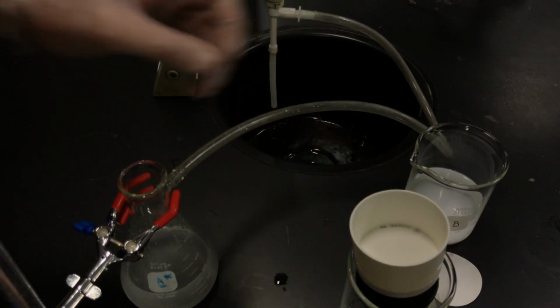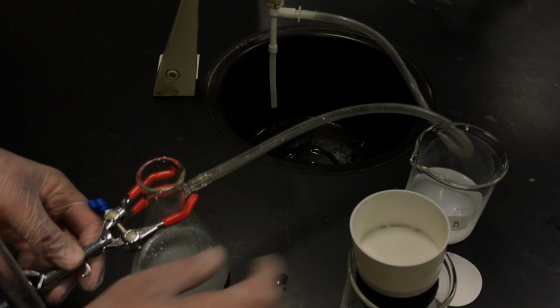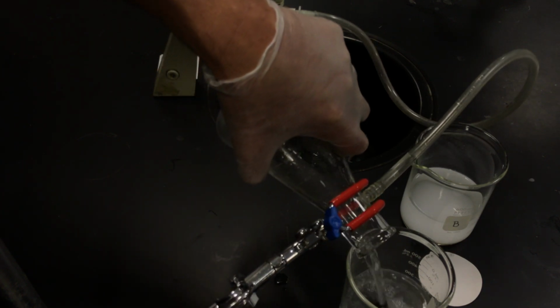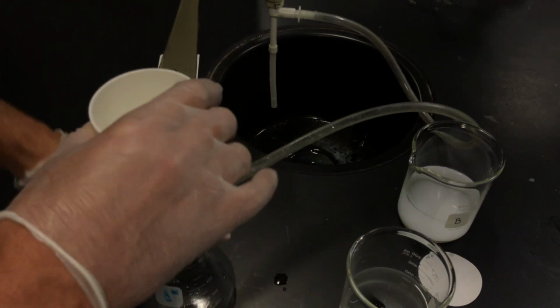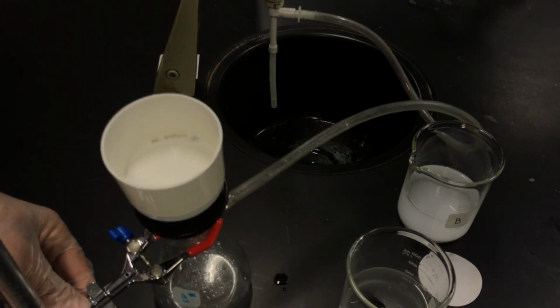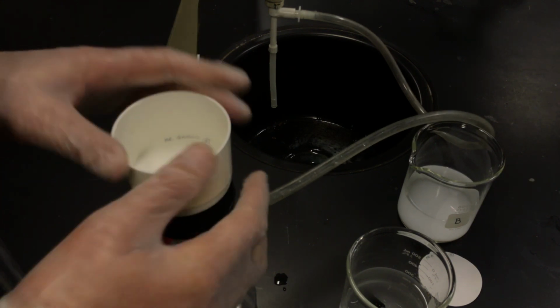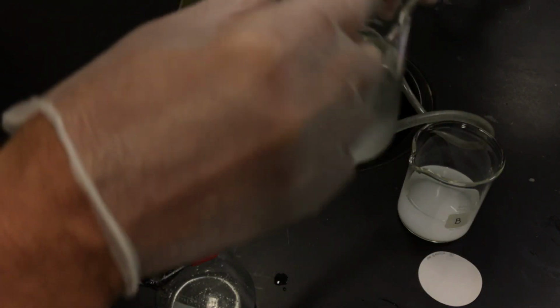Let that stand up. And what I'm going to do is essentially unhook this from the pole stand, and I'm going to pour this through back into the beaker, and we'll filter one more time. Buchner funnel back on, and then I'm going to tighten this clamp up so that I have some good support for my vacuum filtration system. Okay, and you can see that it is a bit cloudy, and we'll try this one more time.